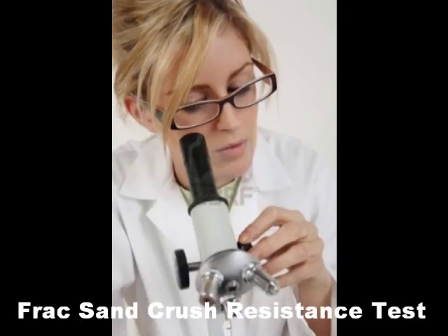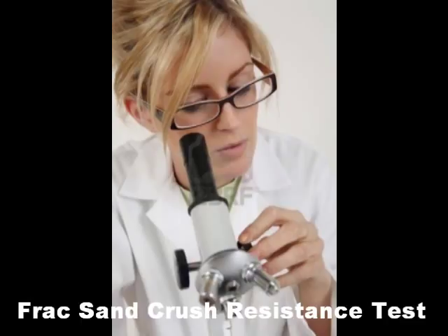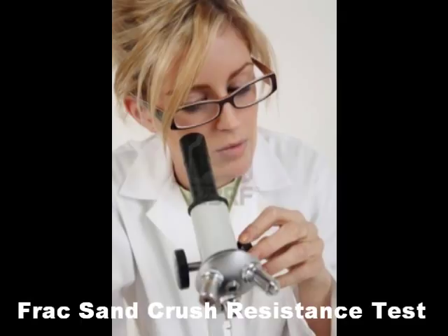This is kind of a granddaddy test — well, I guess a daddy test. A granddaddy would be the conductivity test; that is the big boy of testing. But this crush resistance test is an important test. I love performing this one. It is fun.